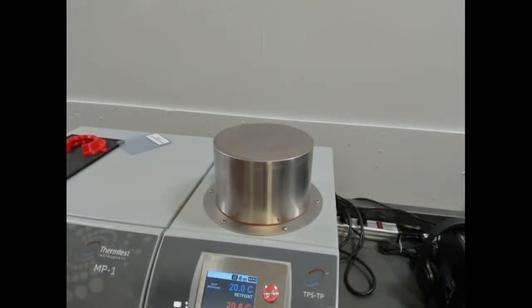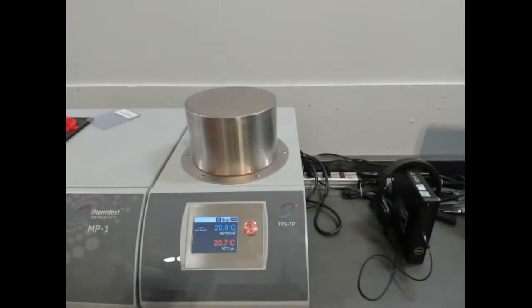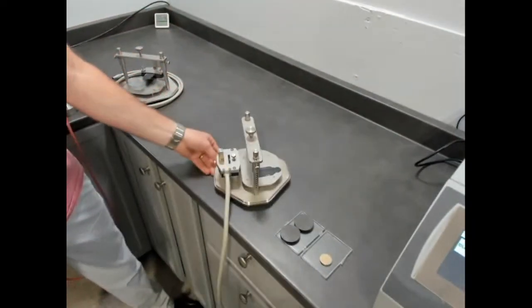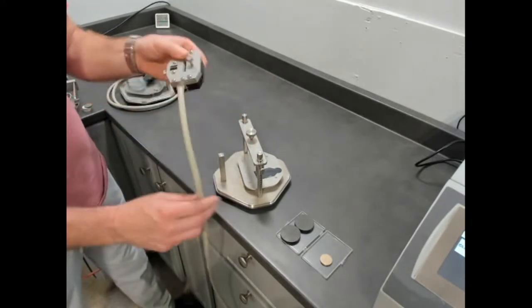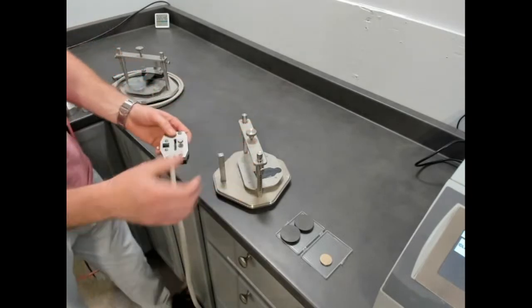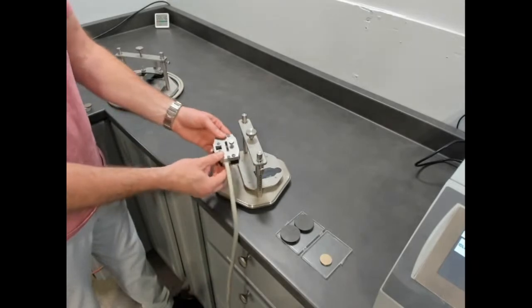All the control of temperature can be done within the software. So we would typically move to the software and schedule a number of steps of temperature and move on. But we're going to come over here and show a symmetric setup for the MP1 using the sample holder. This one is room temperature configuration. You can upgrade this room temperature adapter to a 300 Celsius version so that you can use this as an oven. This would allow you to measure sample sizes much larger, up to 6-inch square and 2-inch thick.